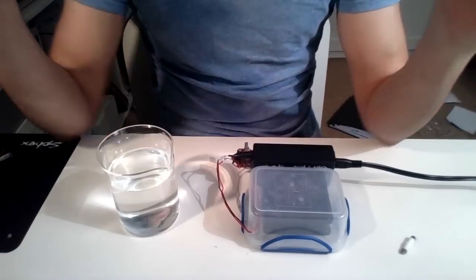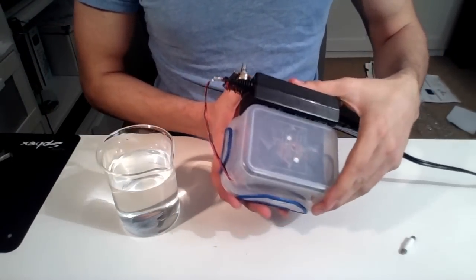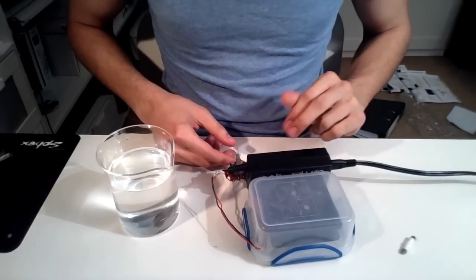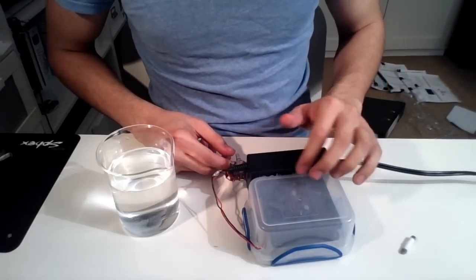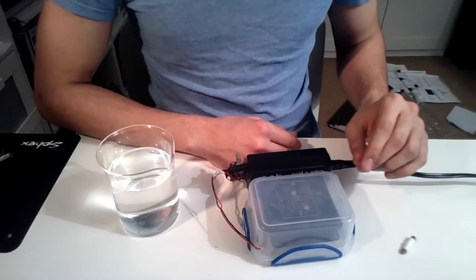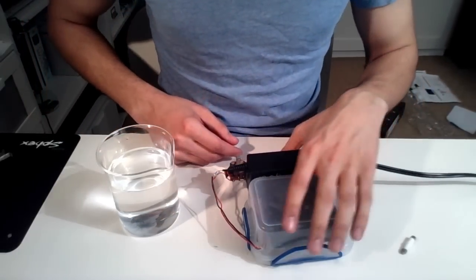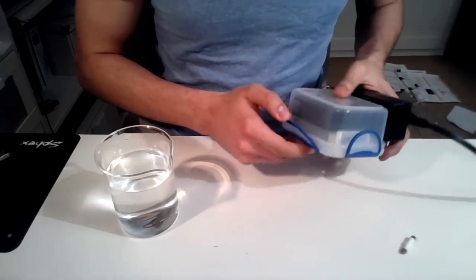Hey guys, I'm here today to show you how I've made this magnetic stirrer. Now, you'll see this in labs just about everywhere, and they start at about $100 from online stores, chemistry stores, just for the basic thing, and they'll go anywhere up to about $1,000 for the ones with the hot plates and the really fancy features.